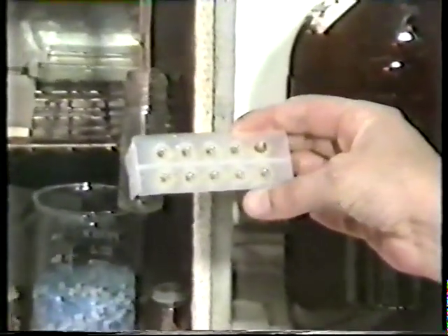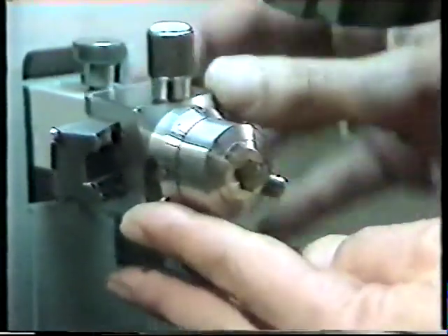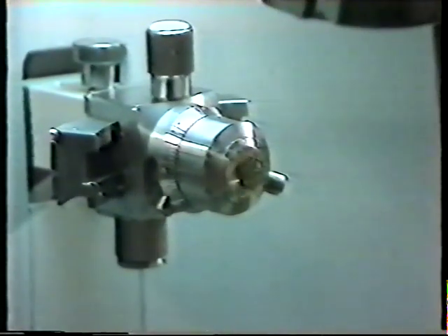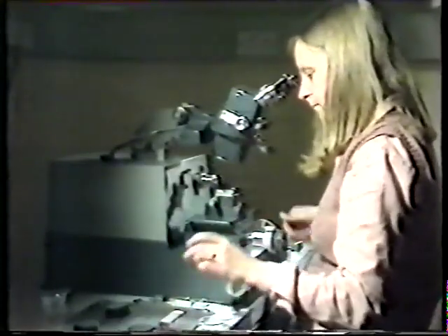The viscous resin hardens, and the tissue, the black material in the resin, can now be sectioned. Whereas in optical microscopy, sections about 10 microns thick are good enough, in electron microscopy, they need to be 200 times thinner, as electrons have such a low penetrating power, and these sections are cut on an ultramicrotome.